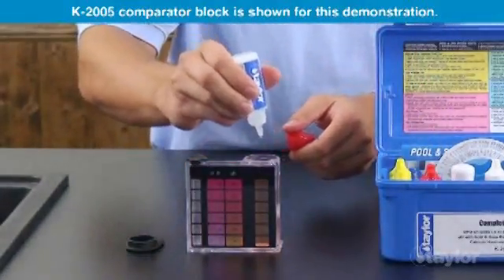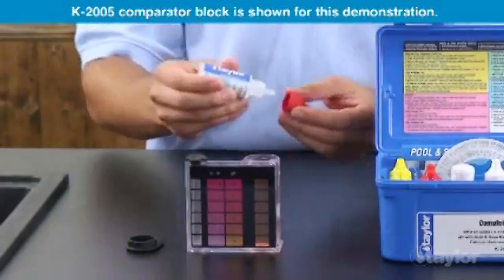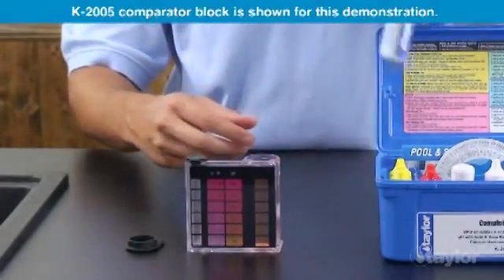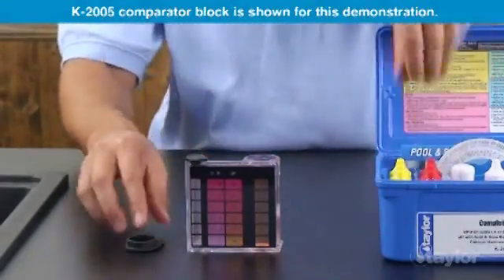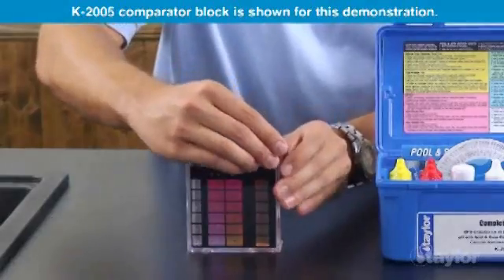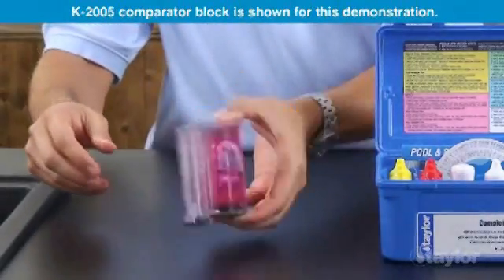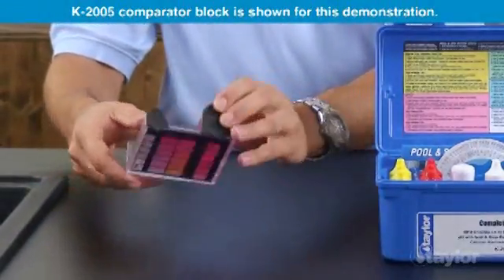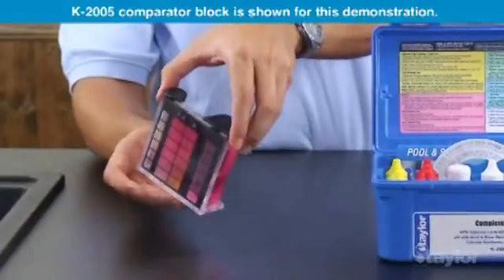Add reagent 6 dropwise. After each drop, count, mix, and compare with the color standards, until the desired pH is matched.